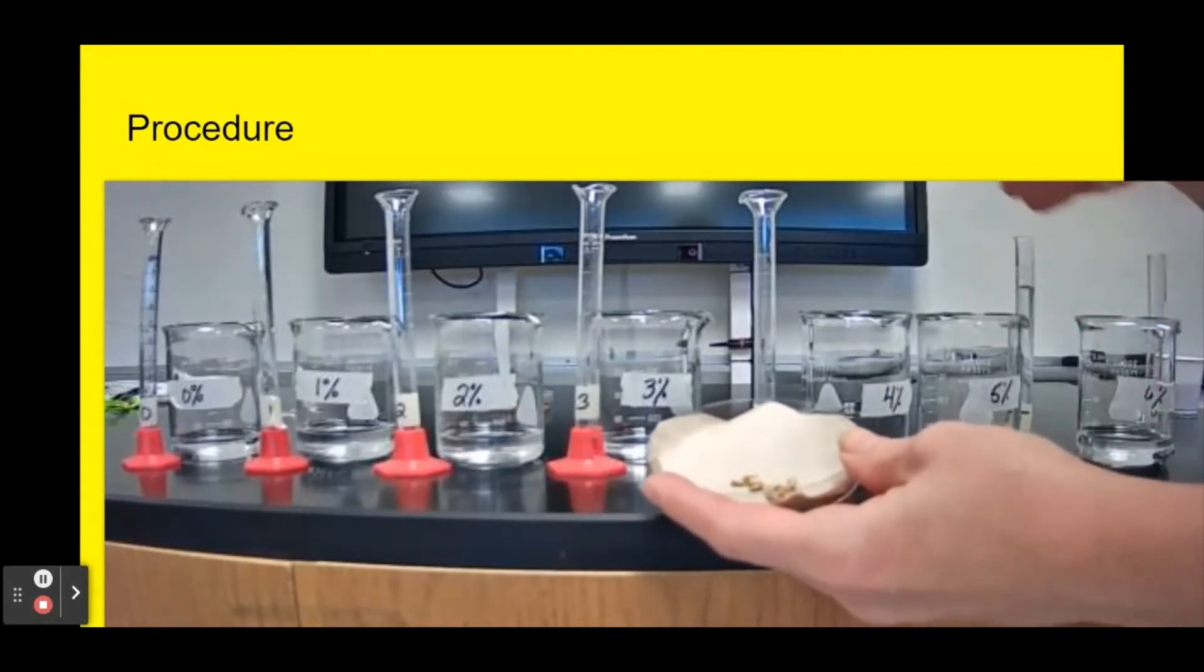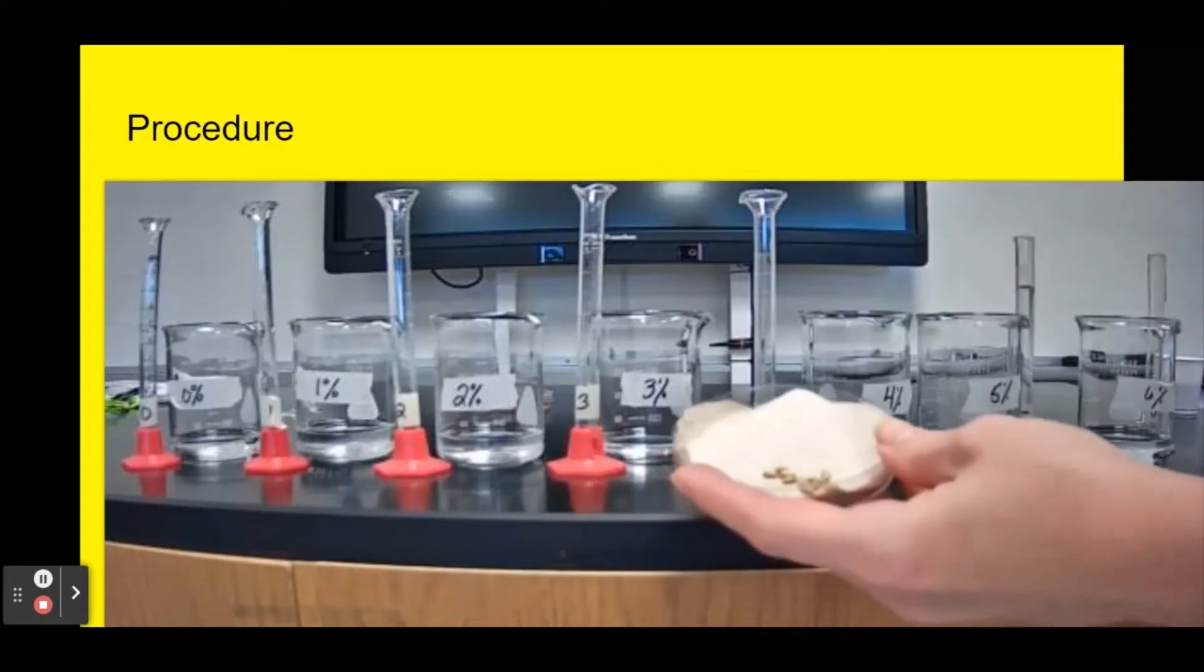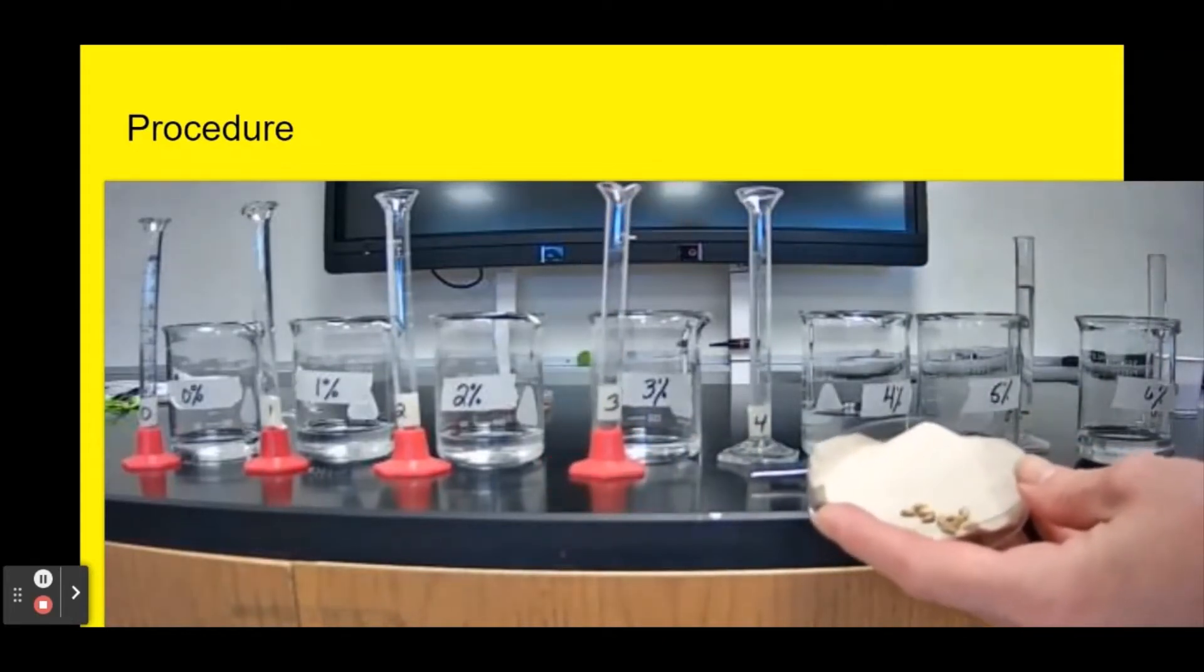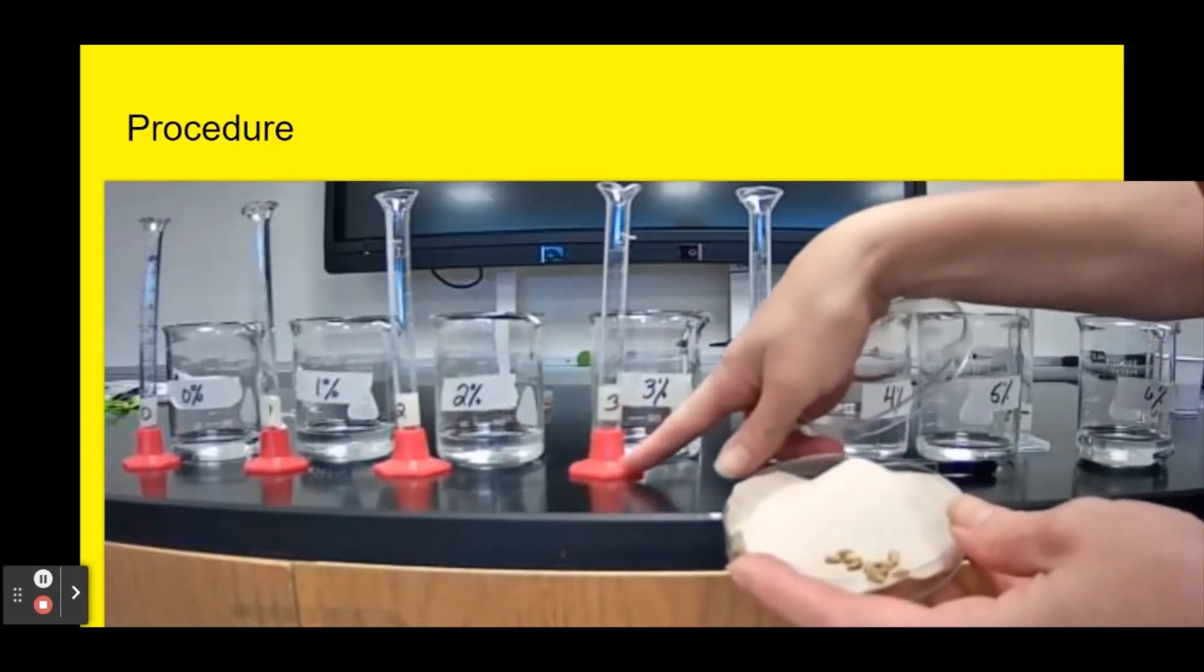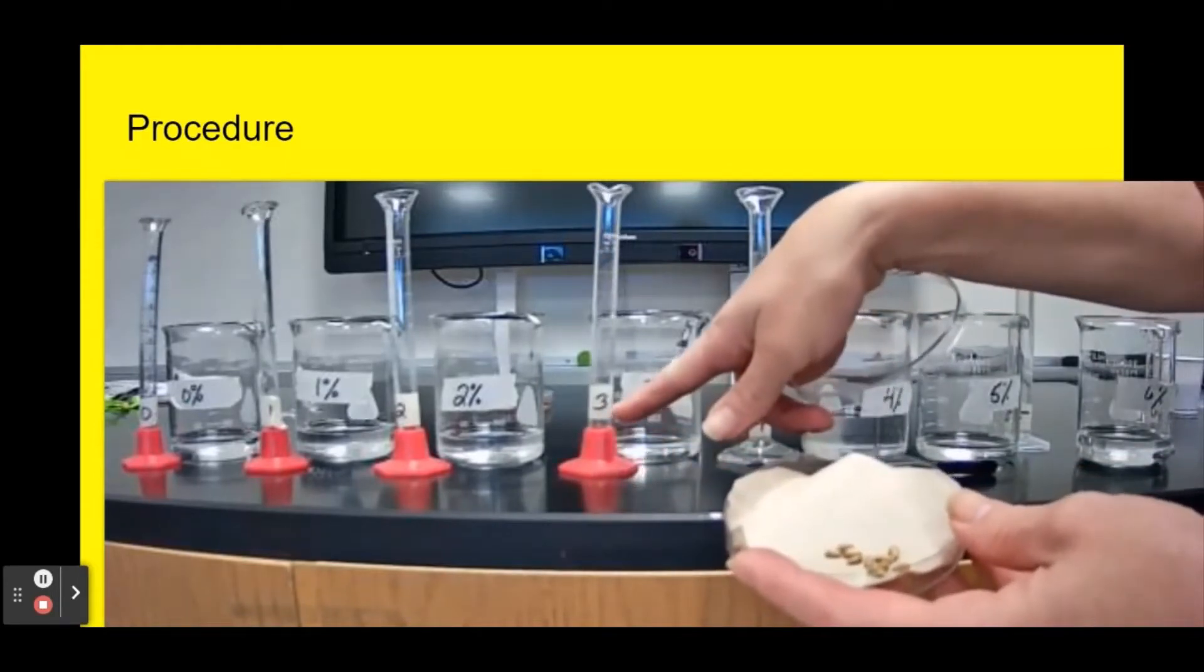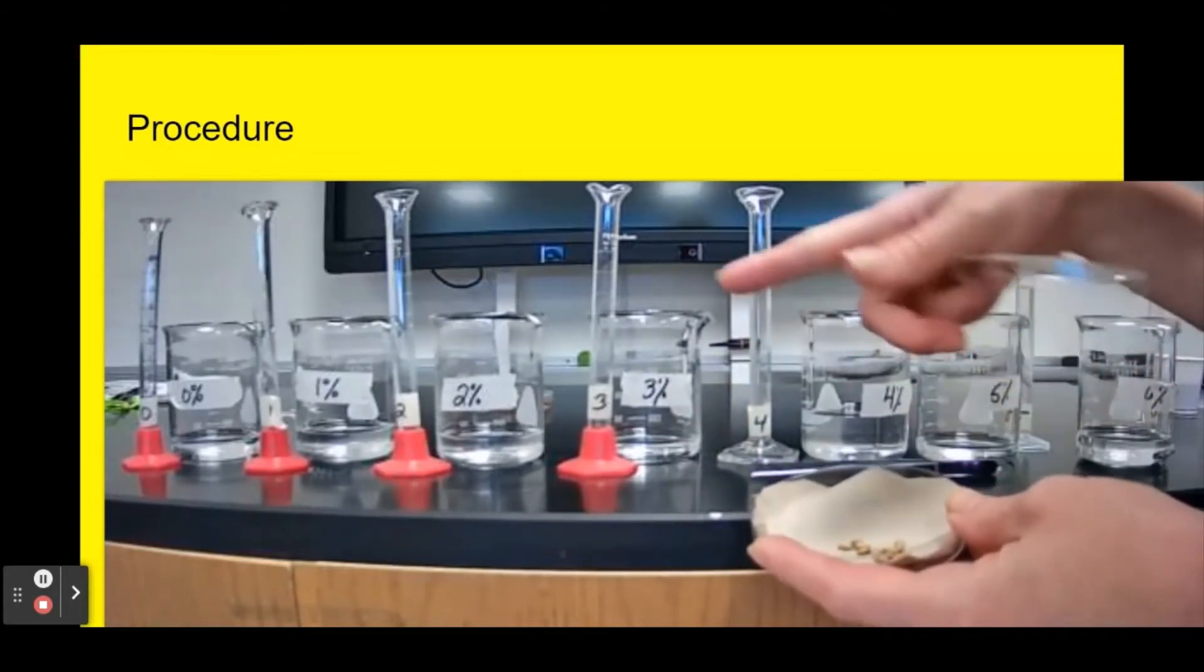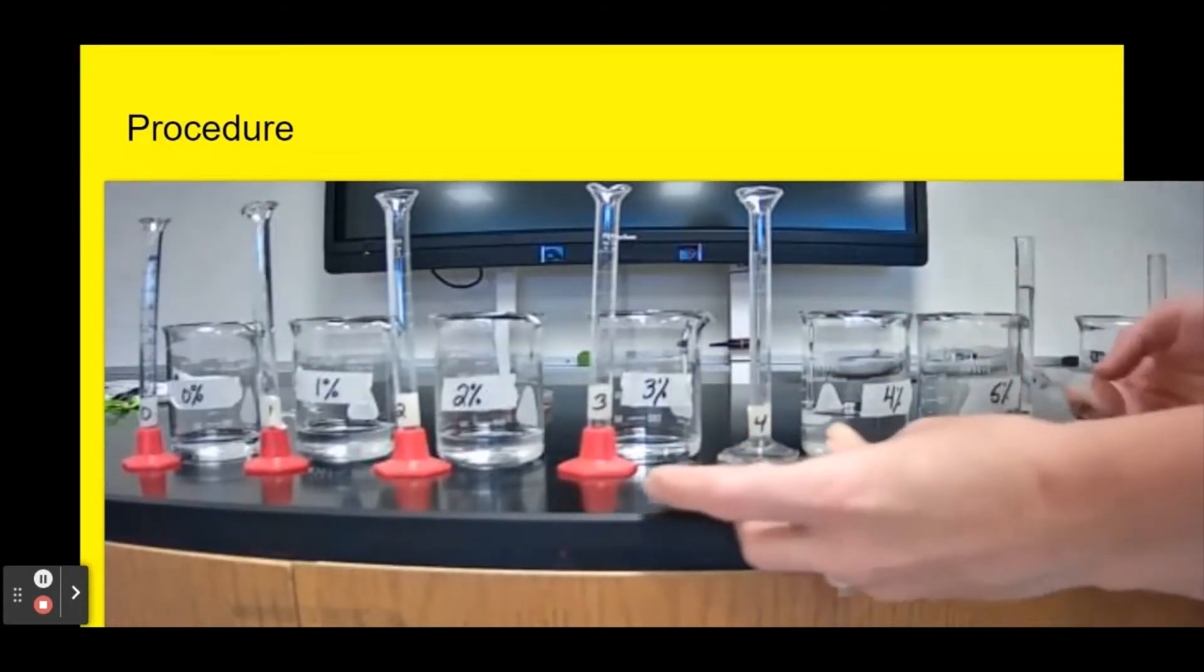I want to make sure it's the same amount of liquid each time and I want to make sure that I don't contaminate my graduated cylinders. That's why I have them labeled so I make sure I only use this graduated cylinder with this solution so that I don't somehow contaminate as I go.